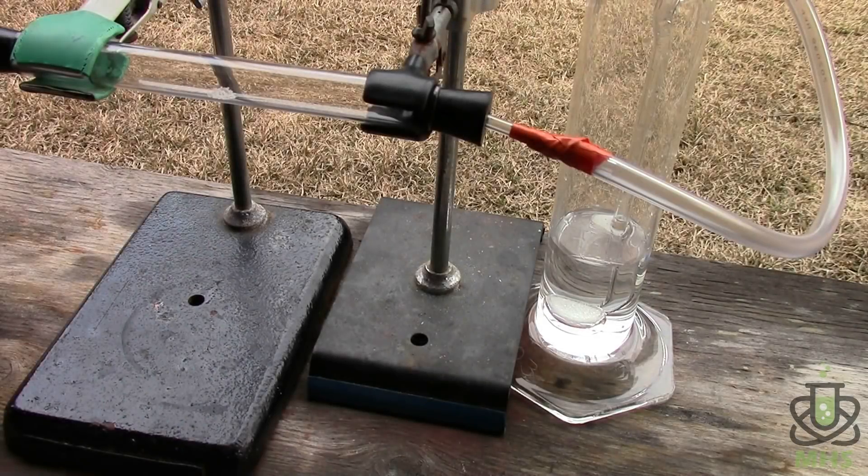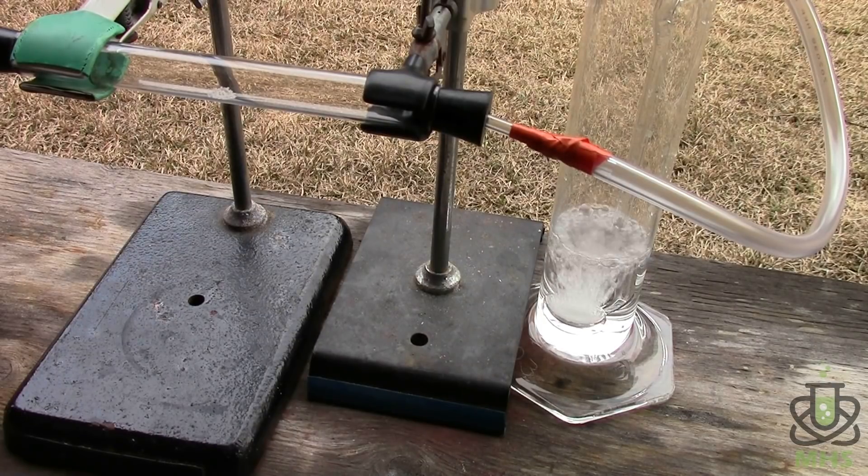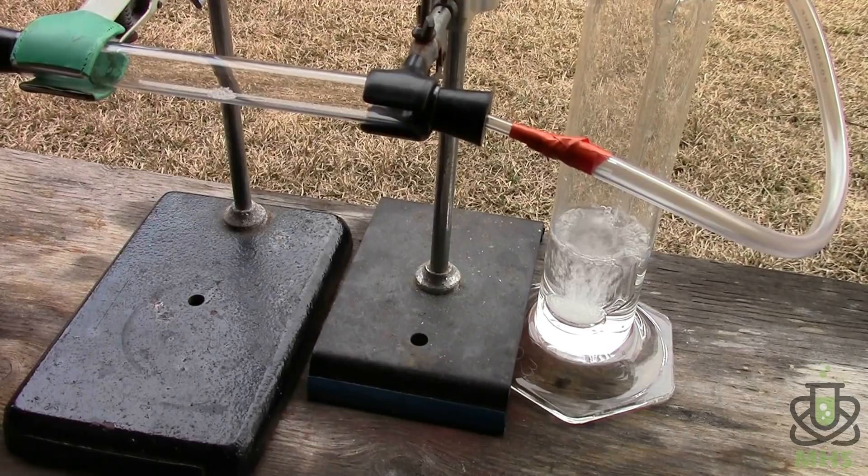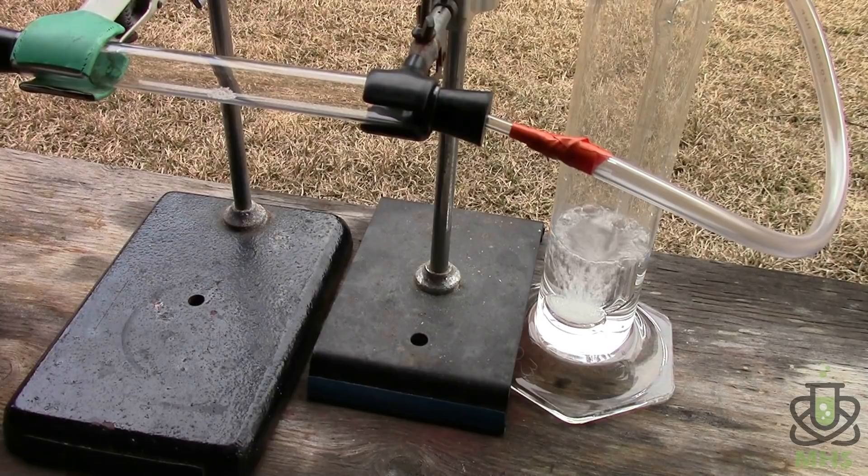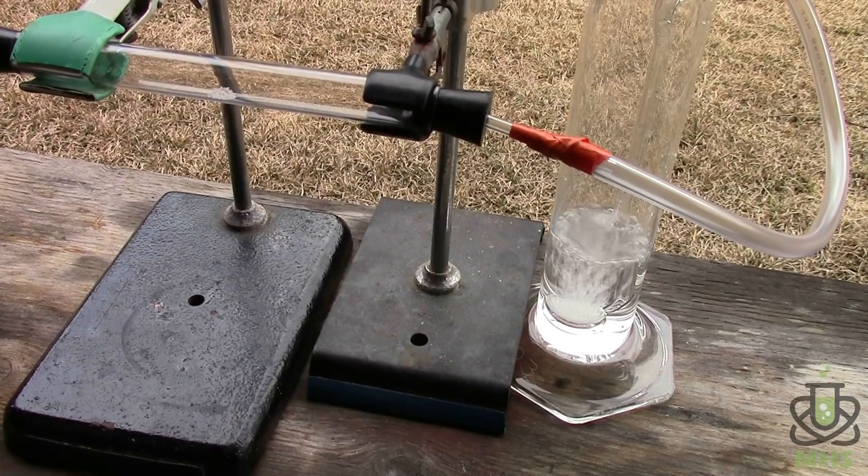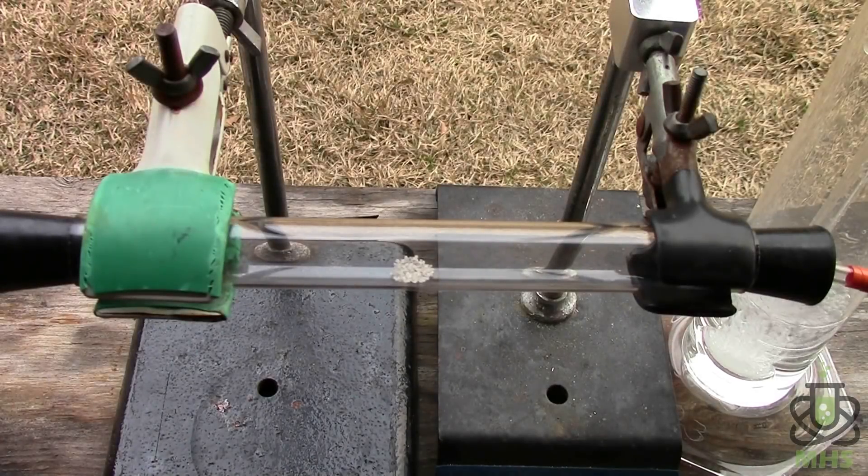Now what I'm going to do is turn the oxygen on just enough so that bubbles start coming out under the water there. So there we go. So now I've got pure oxygen gas bubbling through the lime water and you can see nothing happens because lime water is only reactive towards CO2.